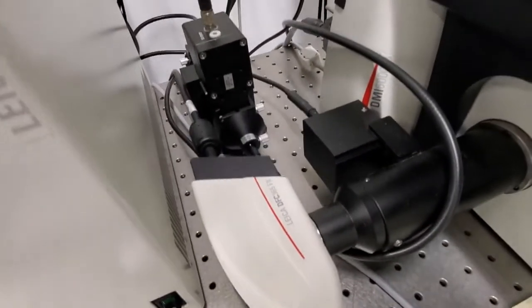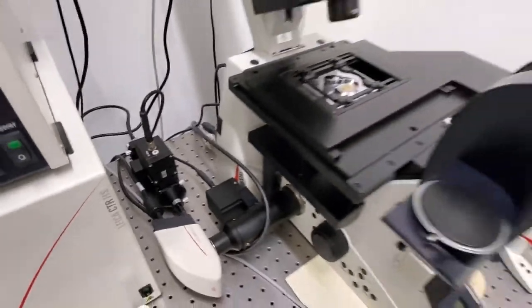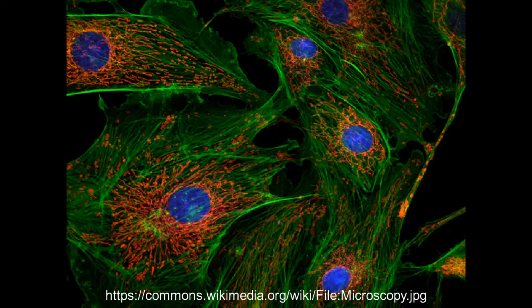Hey there, cucumbers. Fluorescence microscopes are a pretty interesting piece of equipment used in the lab. The most useful feature being that they're able to illustrate specific components of cells using endogenously expressed proteins with fluorescent tags such as GFP or with fluorescently labeled antibodies after fixation.